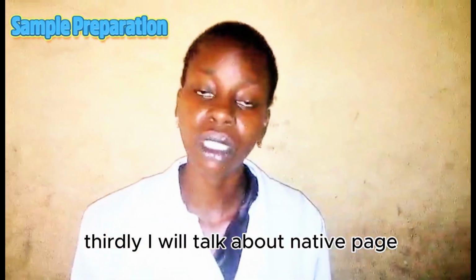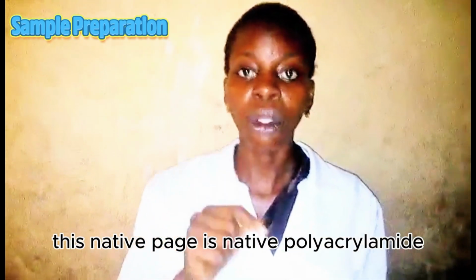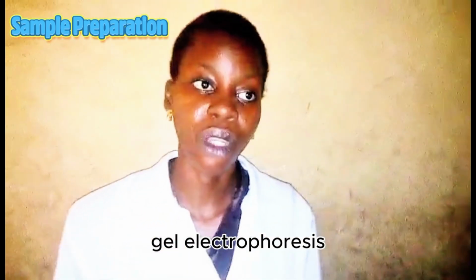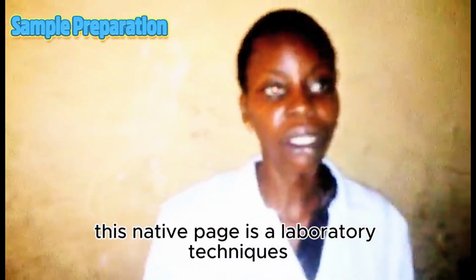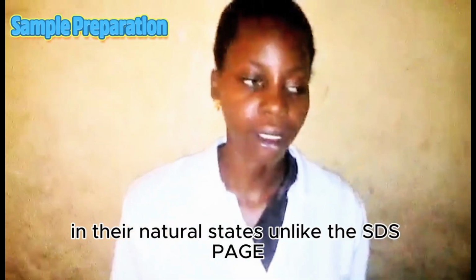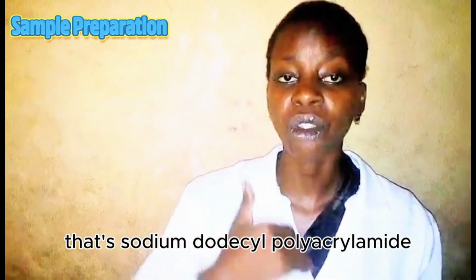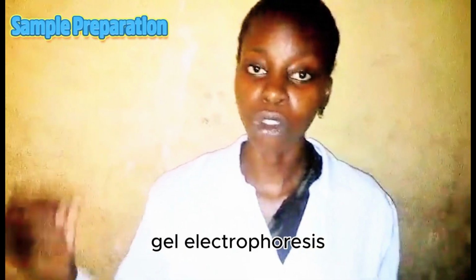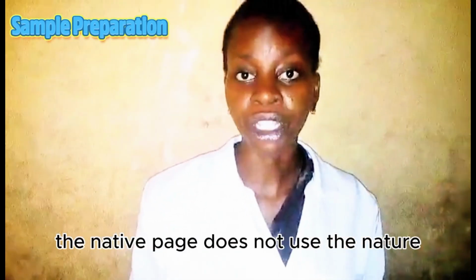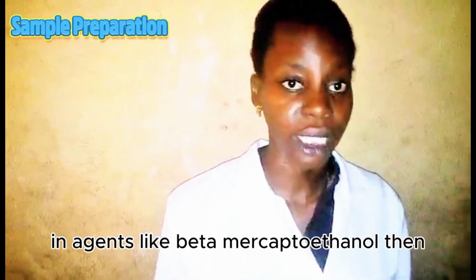Then thirdly, I will talk about native PAGE. This native PAGE is native polyacrylamide gel electrophoresis. This native PAGE is a laboratory technique used to separate proteins in their natural state. Unlike the SDS-PAGE, that's sodium dodecyl sulfate polyacrylamide gel electrophoresis, the native PAGE does not use denaturing agents like beta-mercaptoethanol.